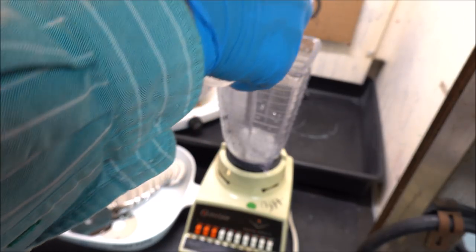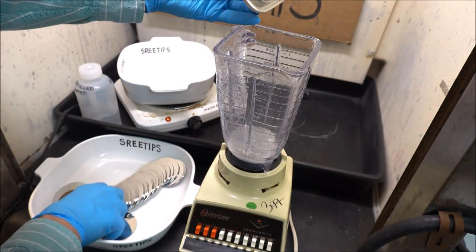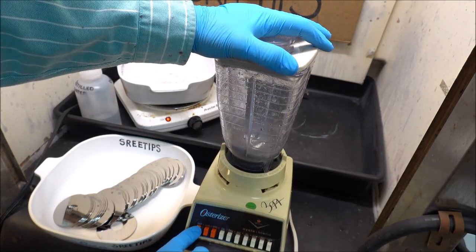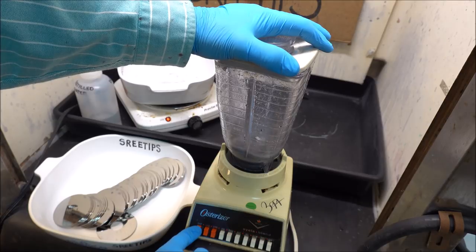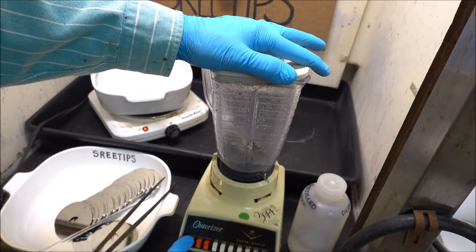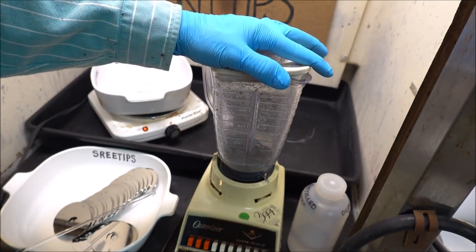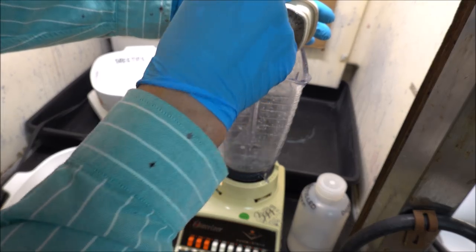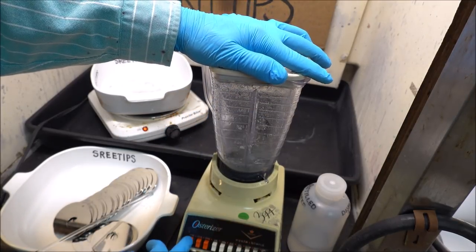In this shot, I'm using a wash bottle to rinse down the larger pieces off the inside of the blender. I put a few more of the disks in. If you notice here, they just kind of lay flat on the surface and spin, they're not getting ground up. I've got about a third of the disks in that blender and it's getting crowded in there so the blades can't come into contact with the platters.